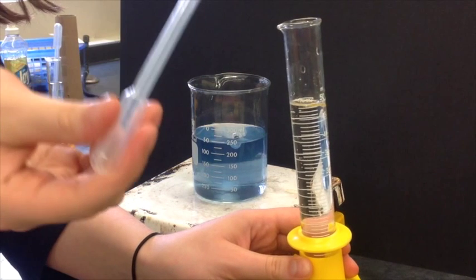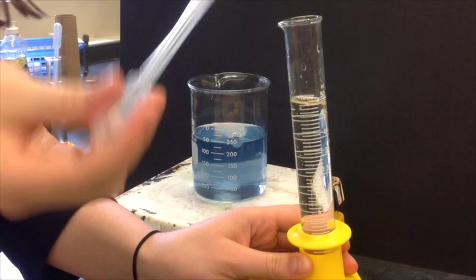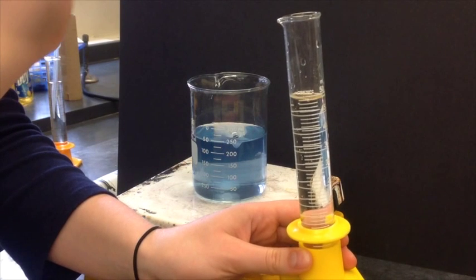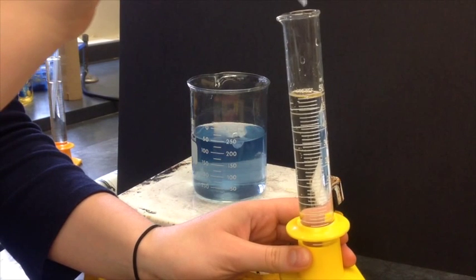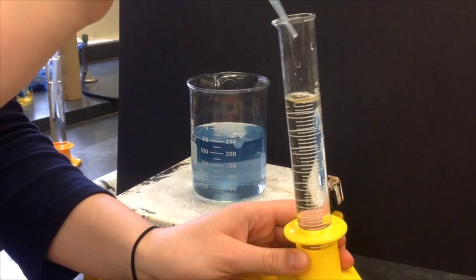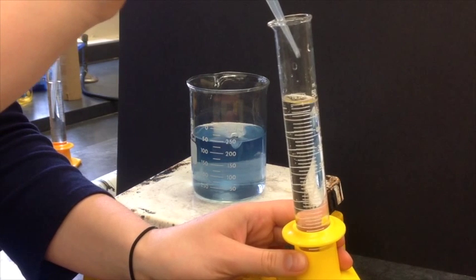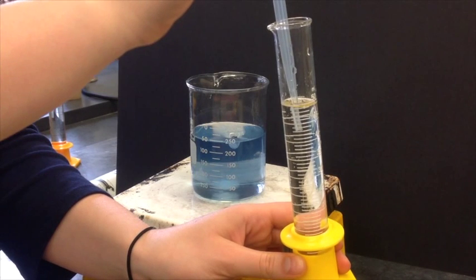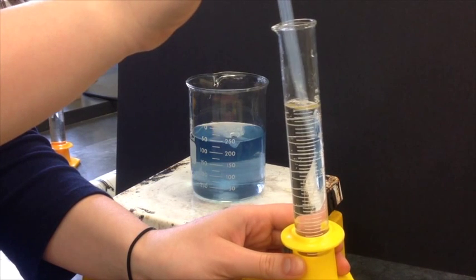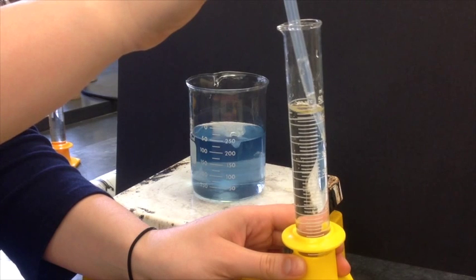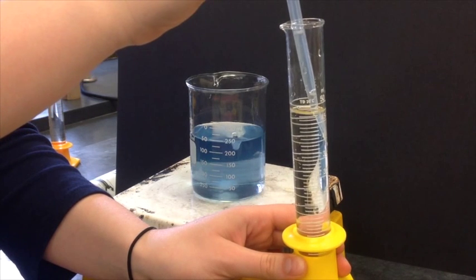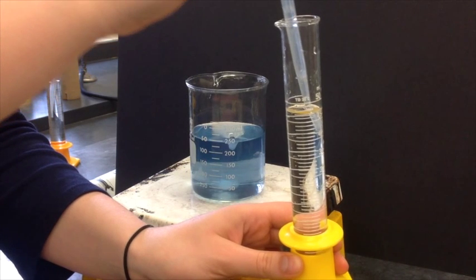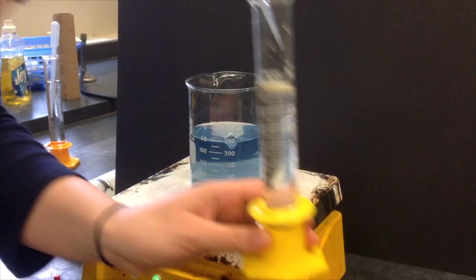What you're about to see is when a concentrated solution of hydrochloric acid is added drop by drop to a stirred, almost clear solution of casein and dilute base, the mixture develops a translucent cloudiness, which persists longer and longer as more acid is added, until suddenly the entire solution turns into a milky substance. An additional two to three drops of acid causes the solution to be clear once more. This process can easily be reversed by adding concentrated sodium hydroxide drop by drop to the now acidic solution that will then become basic.